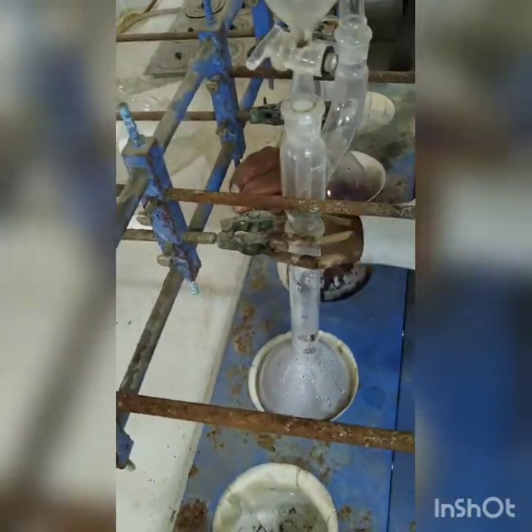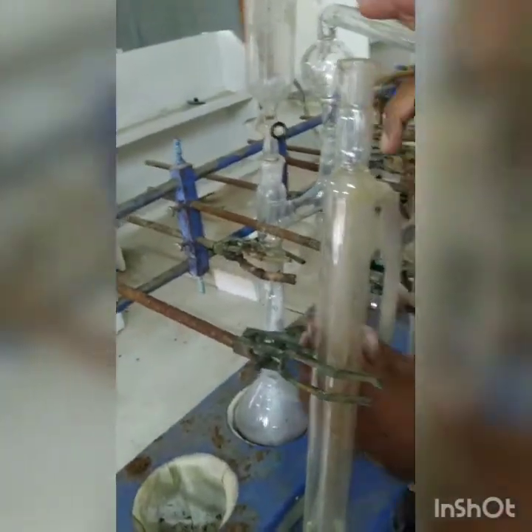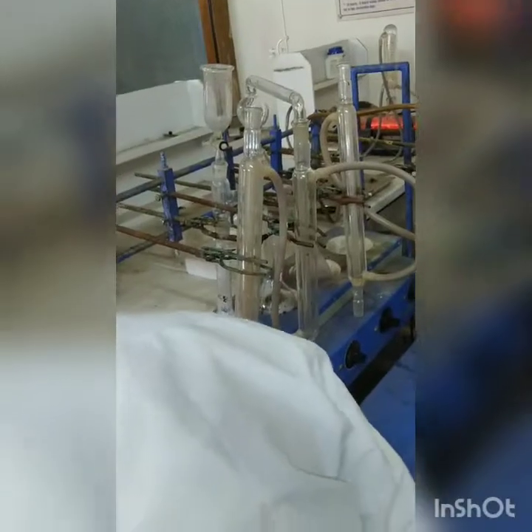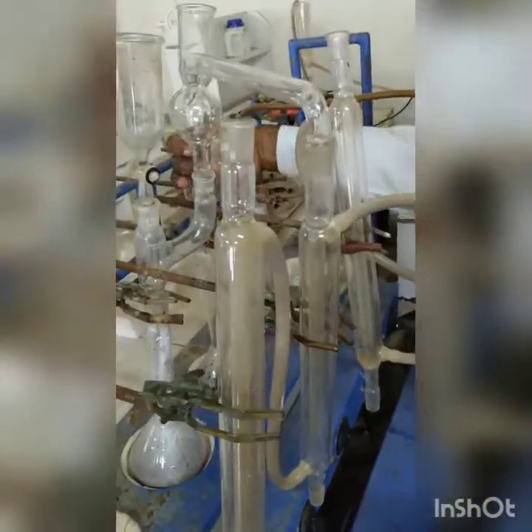So this needs to be done very carefully, and the experience comes into picture. So our lab assistant Ingole sir is very well conversant with this procedure. So he is arranging the distillation assembly, as you can see. Now it has been arranged for 1. Similarly, he will arrange for the remaining 2, and then we will actually start the distillation procedure. Again, that part we will do on our own, and we will start with the distillation procedure.